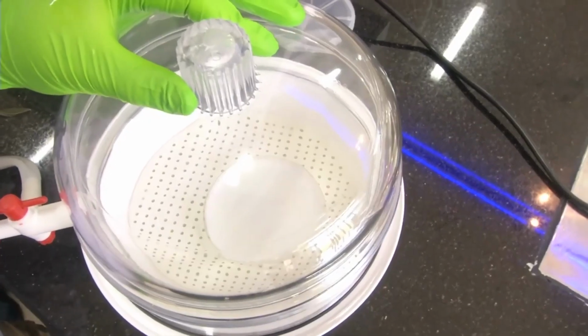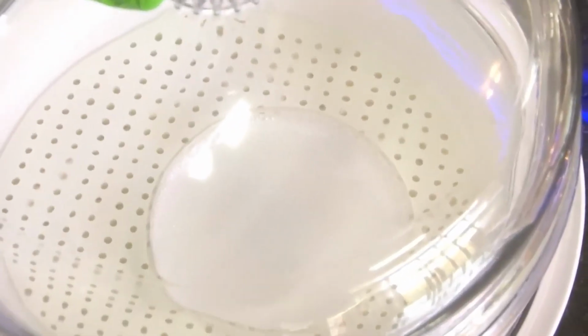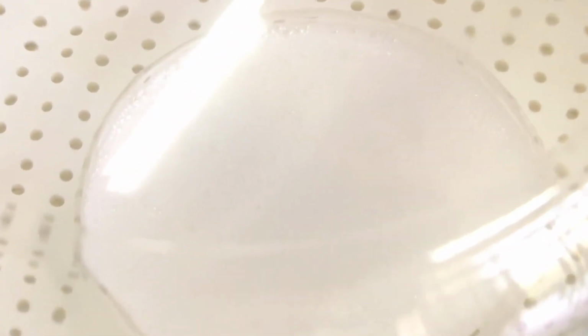So just now we saw the air bubbles. See, air bubbles are accumulating at the top of the dish, as you have seen in the close-up video grab. All the air bubbles are coming out. So as and when all the air bubbles come out, it will become a clear solution. It will take around 25 to 30 minutes to remove all the air bubbles from the mixture.